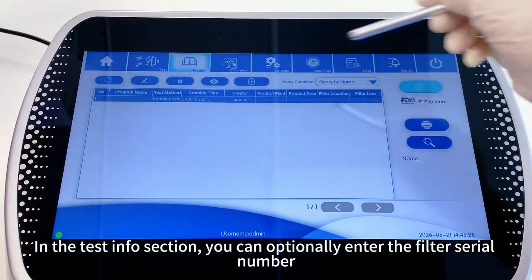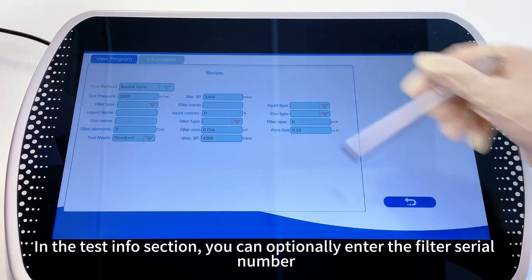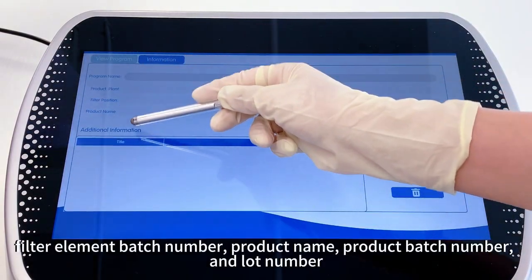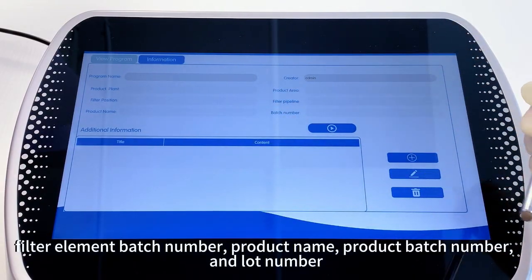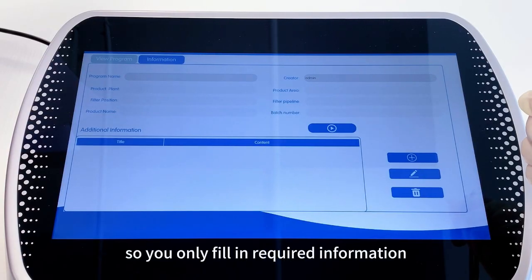In the test info section, you can optionally enter the filter serial number, filter element batch number, product name, product batch number, and lot number. All fields are optional, so you only fill in required information.